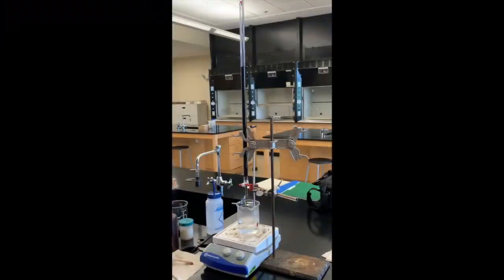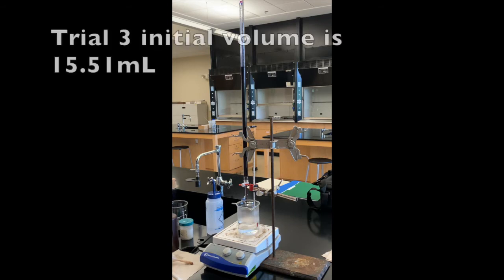Okay, our solution is hot enough to titrate. So our initial volume for trial three of Part C is 15.51 milliliters.